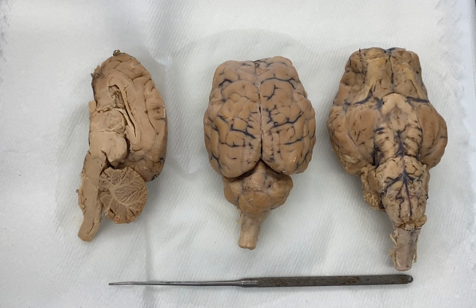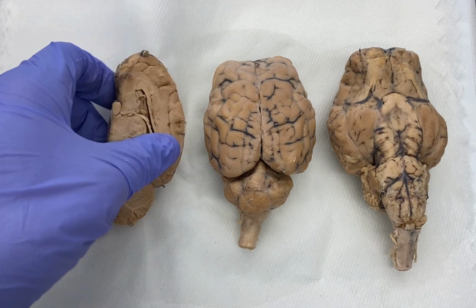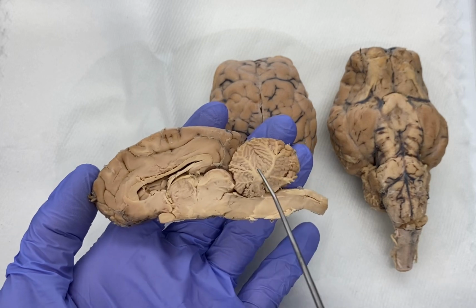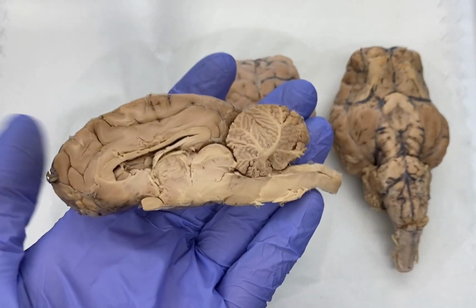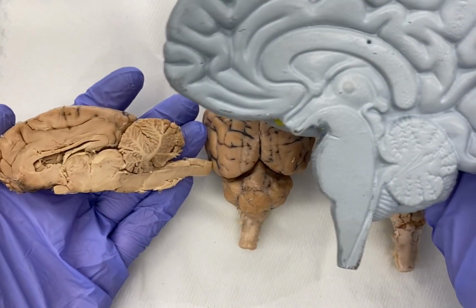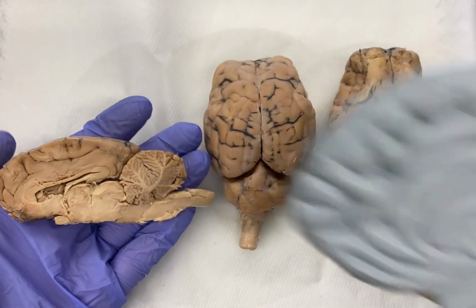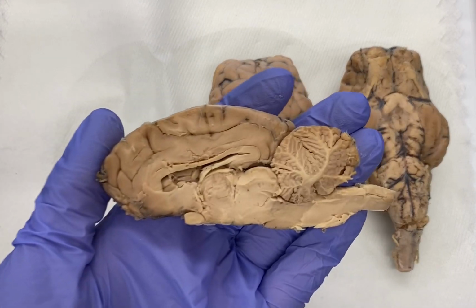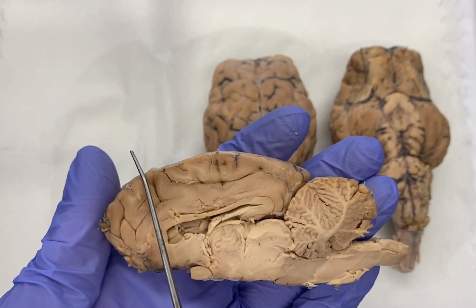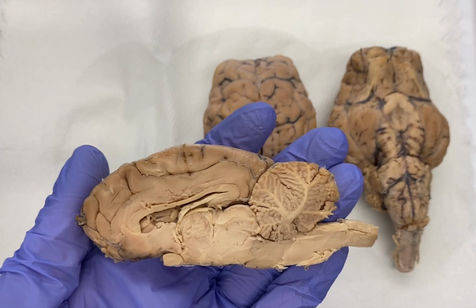So if we look here at our left brain image here, we can see a number of things. If you look on the inside of the brain, again, this is equivalent to this region of our human brain. So this is kind of where we're looking. There are a number of things that we're going to look at. We already looked at our cerebral cortex, some of the white and gray matter, and some of the lobes.